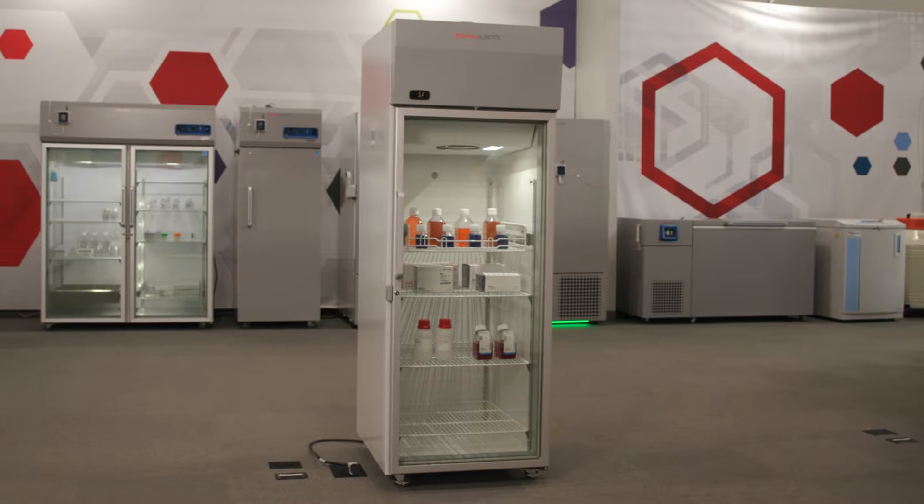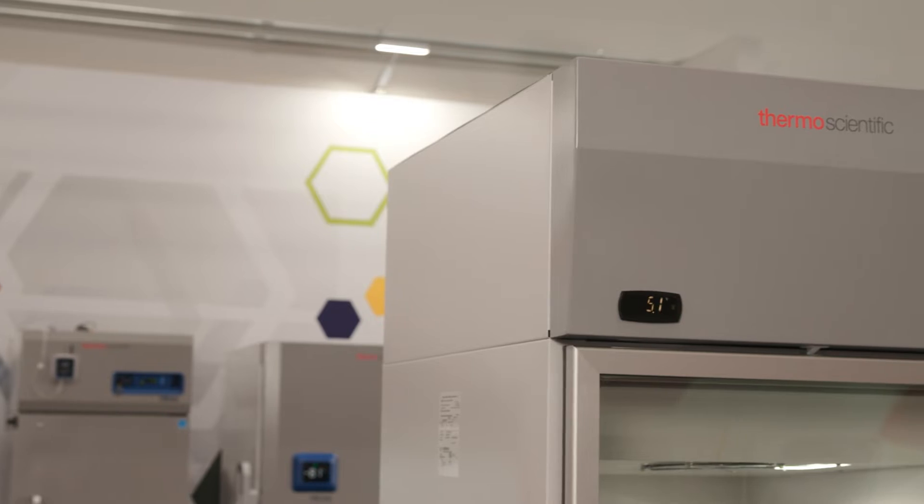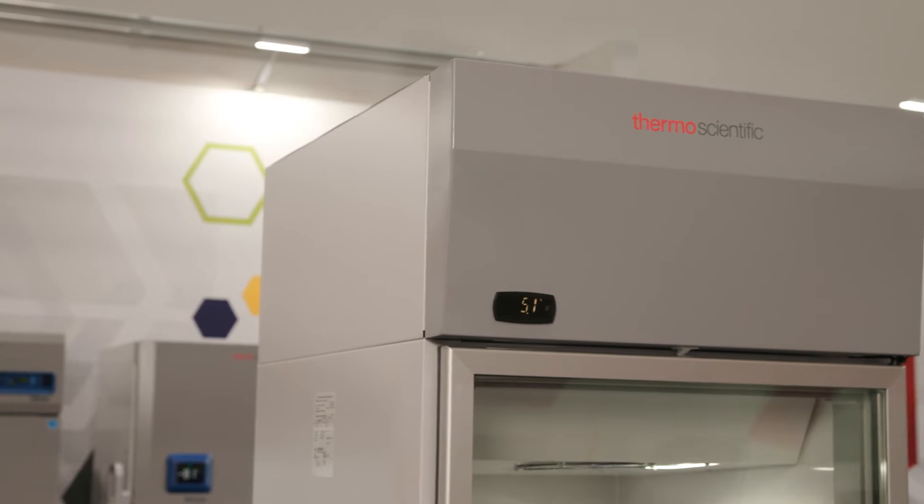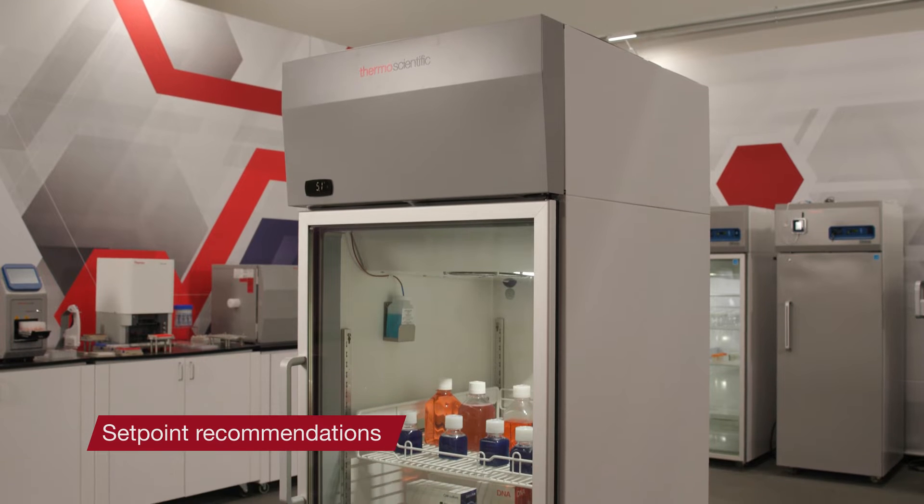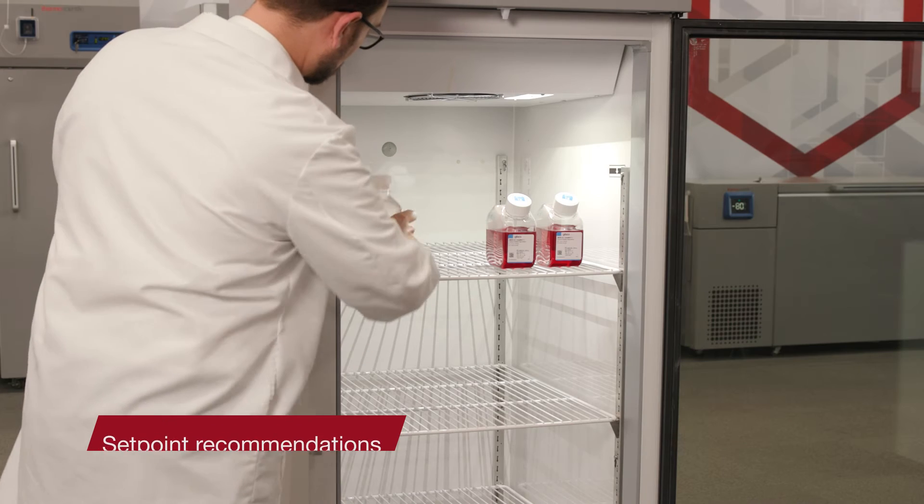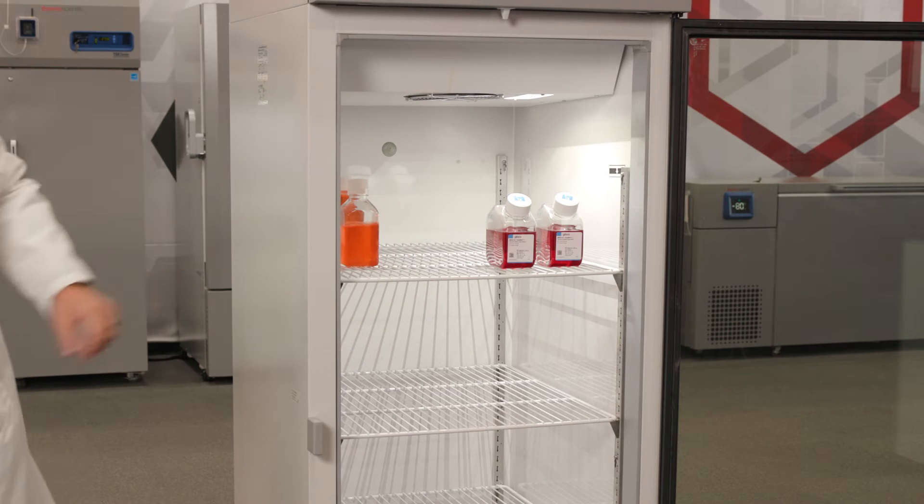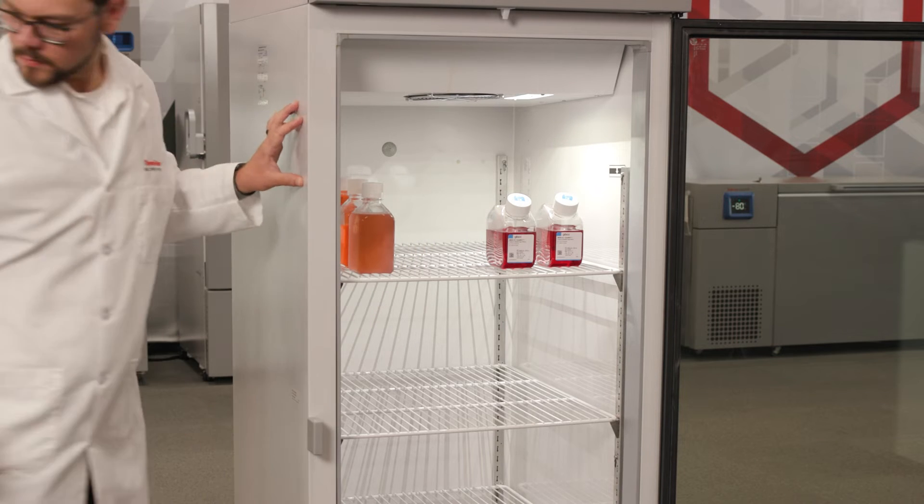Learn how to change the temperature setpoint on your new ThermoScientific TSG series laboratory and pharmacy refrigerator. Adjusting the temperature setpoint is not recommended. TSG series laboratory and pharmacy refrigerators are preset and designed to perform optimally at five degrees Celsius.